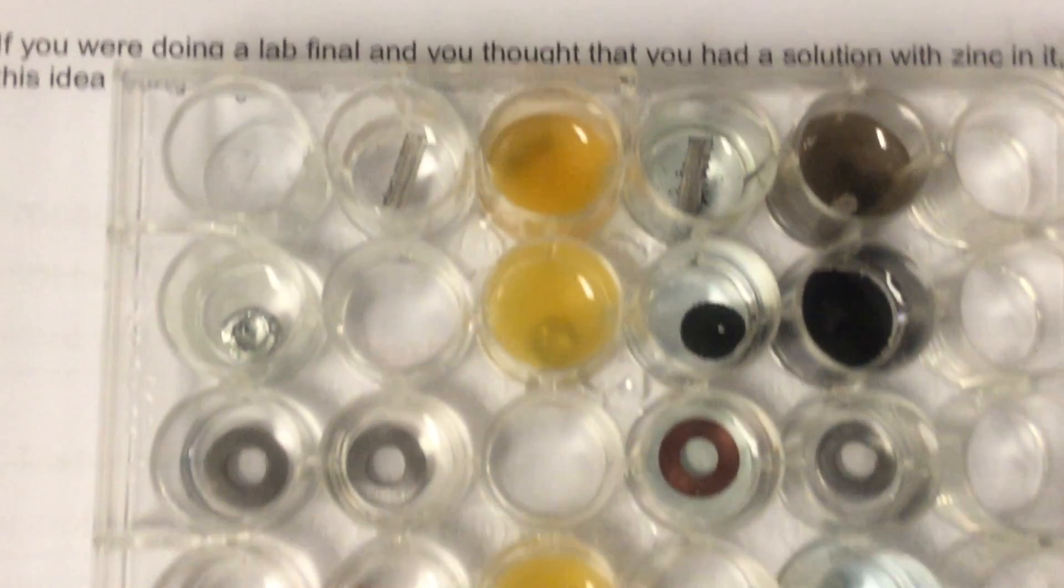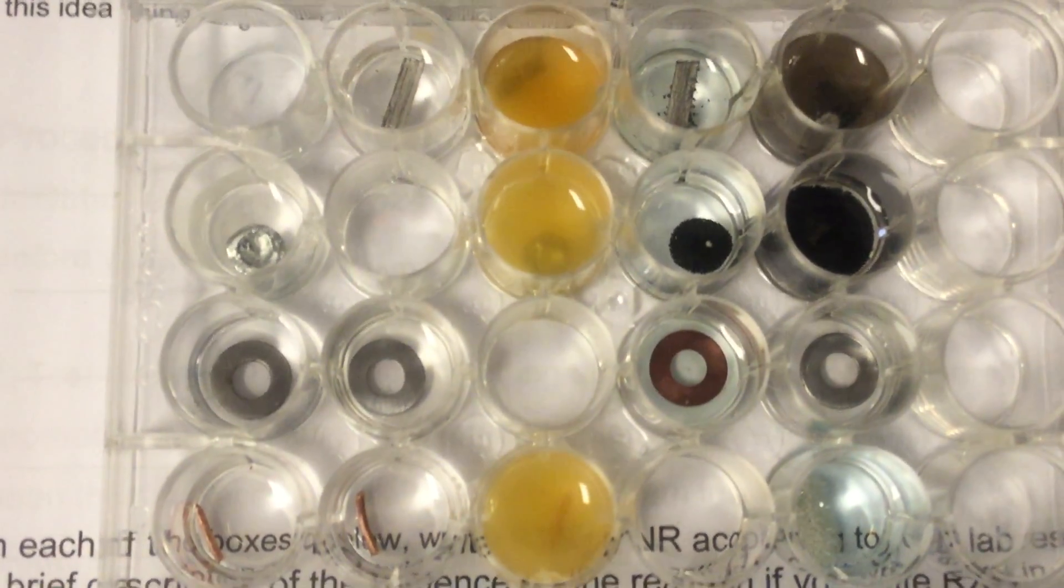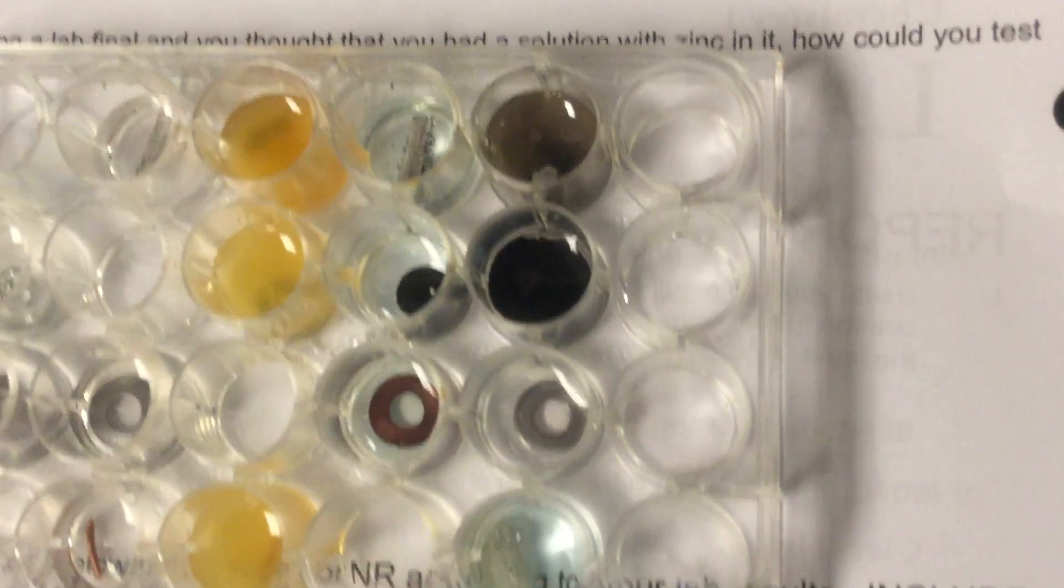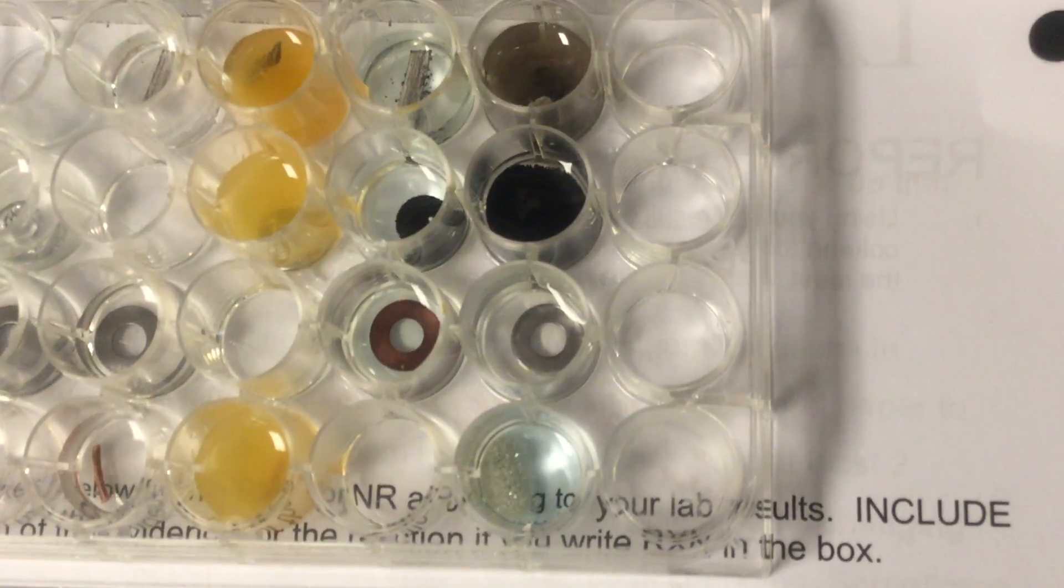Getting a little closer-up view so we can definitely see what's going on.